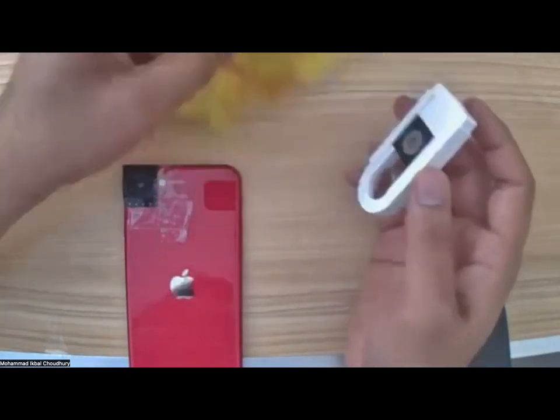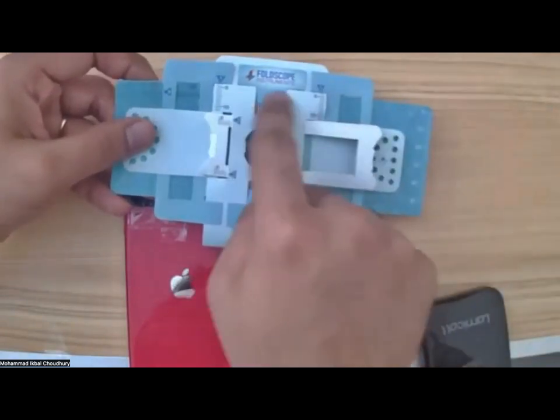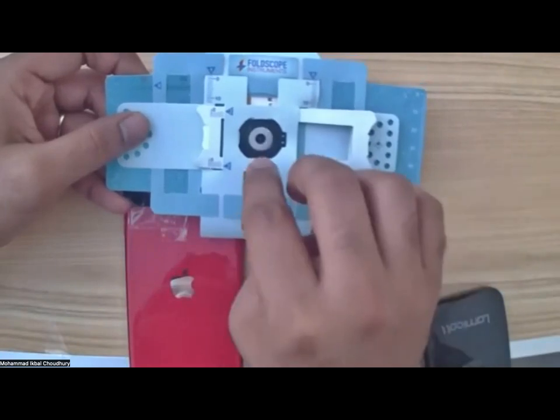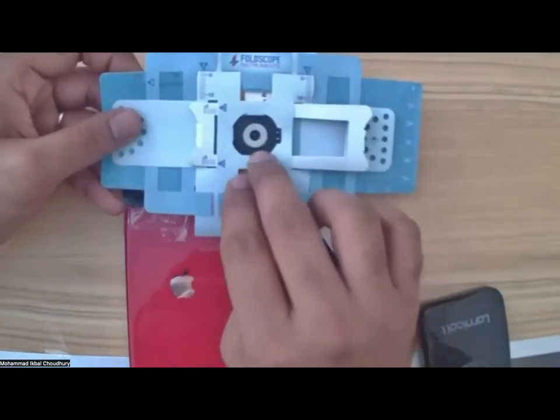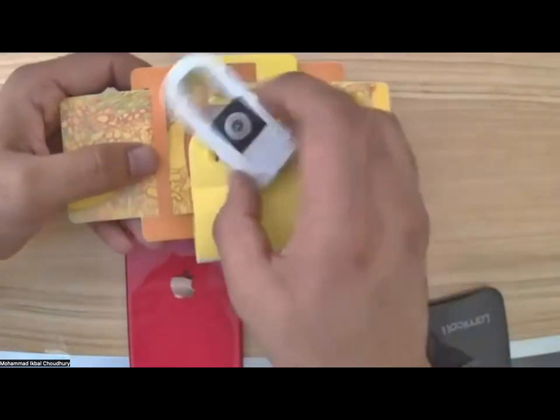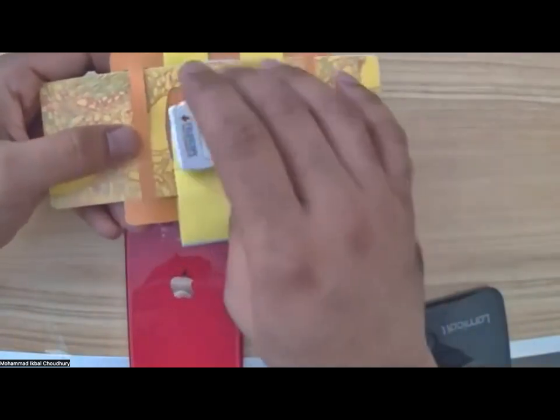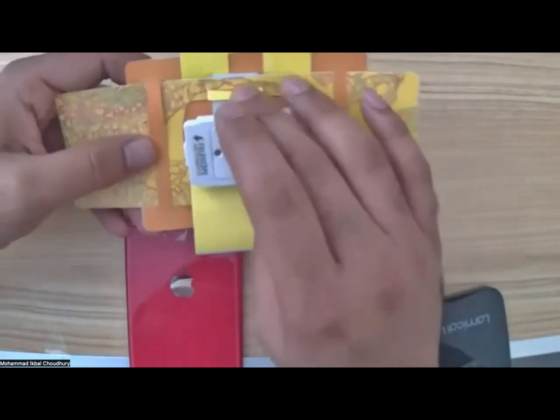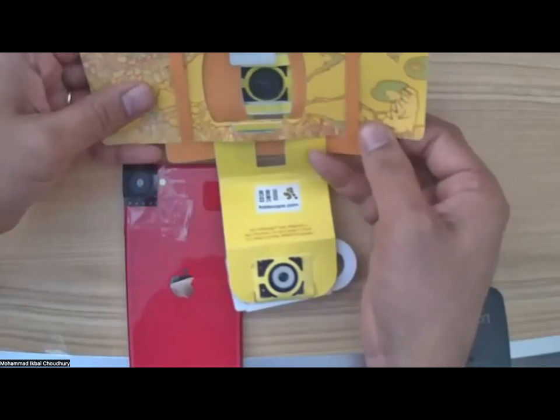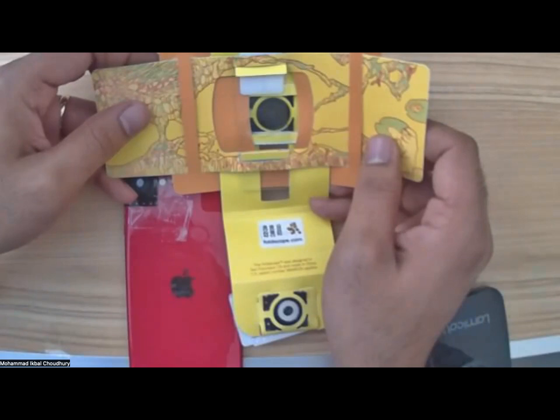So again, just to reiterate, the blue side of the foldscope where you have Foldscope Instruments written on top is your camera side. So you connect your phone camera on this side. The other side is your light source. So the light source goes in like that. You don't have to align it or whatever. You can keep it horizontal, vertical, it doesn't matter. Now, since I've been moving my foldscope, just to clarify, everyone is good here? So far, so good. Wonderful.